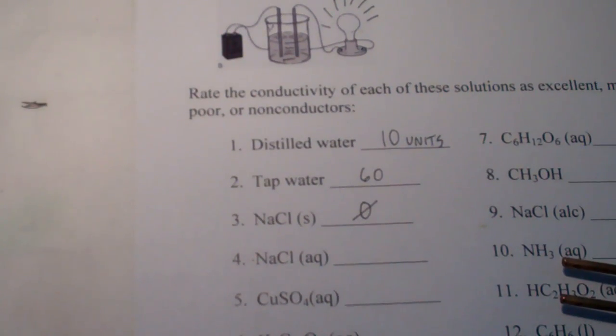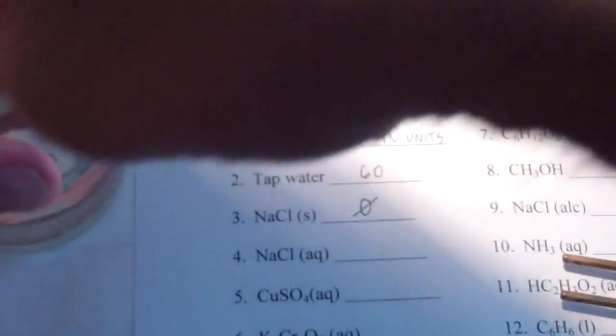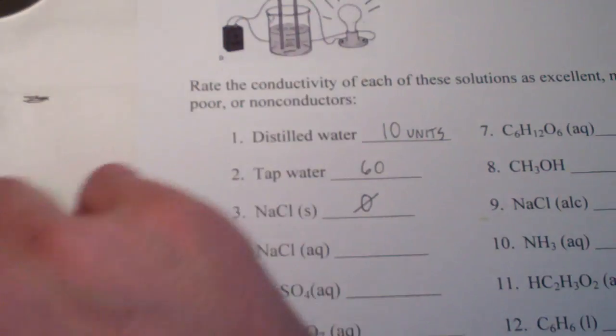Okay, let's try the next step. Which is sodium chloride AQ. You guys know that AQ means dissolved in water. So, let's take a look at this and see how well this conducts. Place our meter in there. And we'll press the low button, and it says 10+. So, we'll press the high, and it's up to 8. So, on our scale, we would call that 80 units.